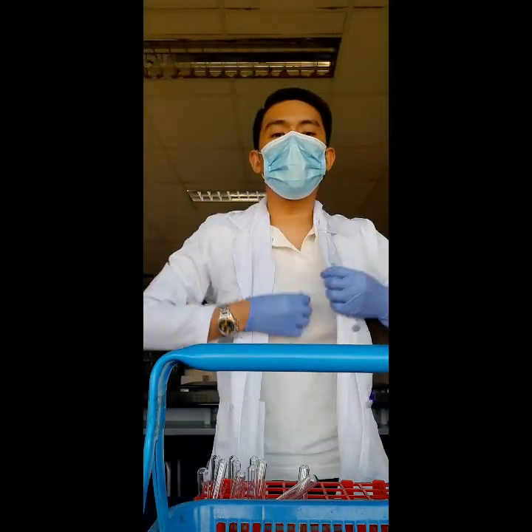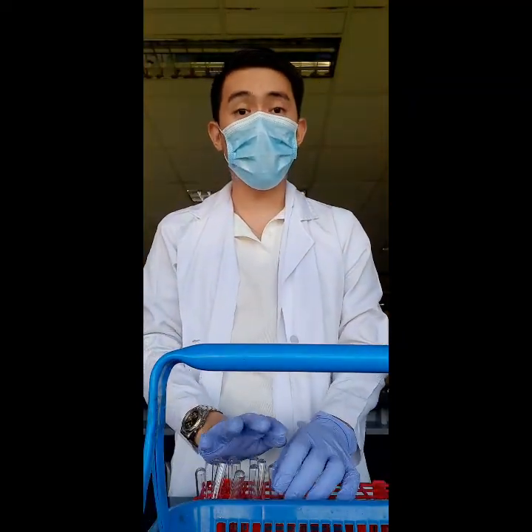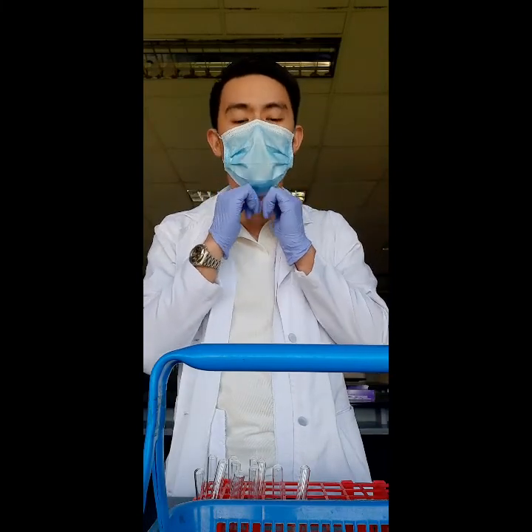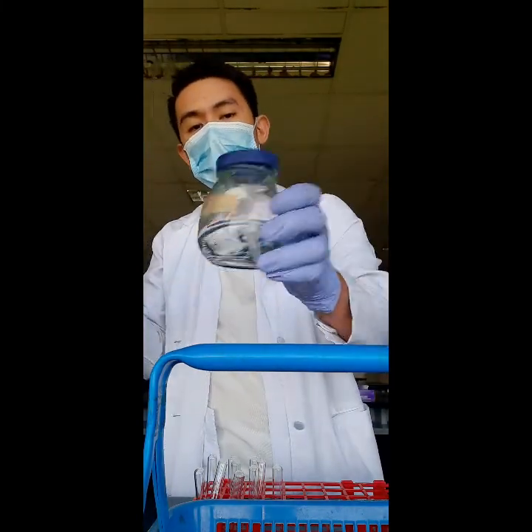This is for our midterm. This is the start of our midterm for our Group 1 anions. We will start with our first anion, beginning by adding 10 drops of 3F HCl.